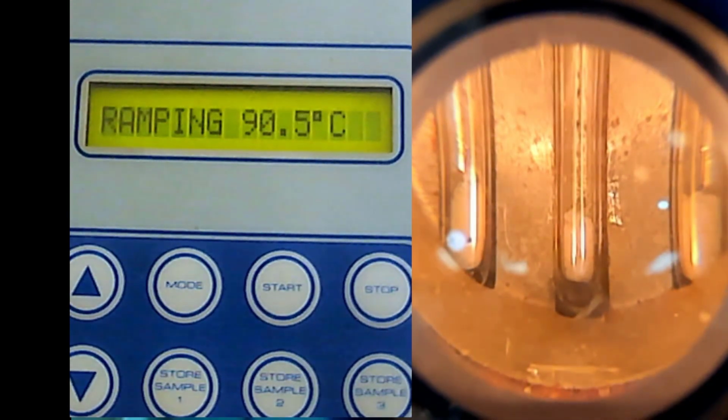So it's already 9:30. Maybe another 15 to 20 minutes, because after this we will see the recrystallization. There are 2 experiments today. So if we go beyond 1 hour, it's still okay, because a real lab will take around 3 hours and more. But now I've compressed it to about 1 hour, maybe 1 hour and a half. I think it's okay for you.